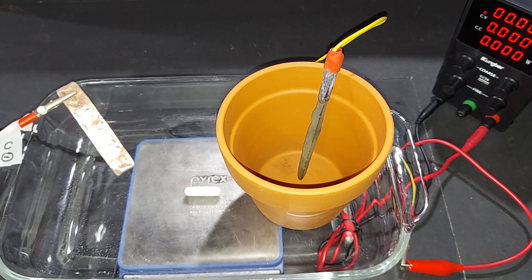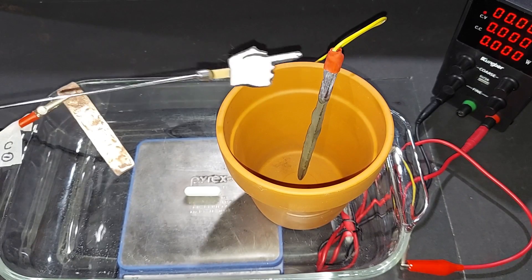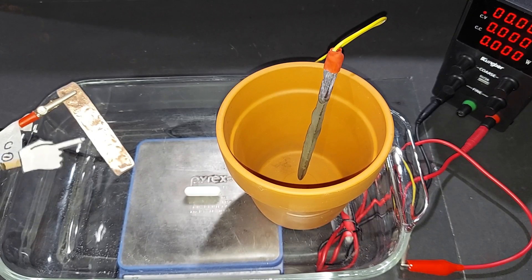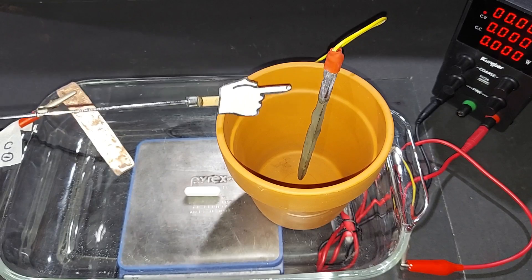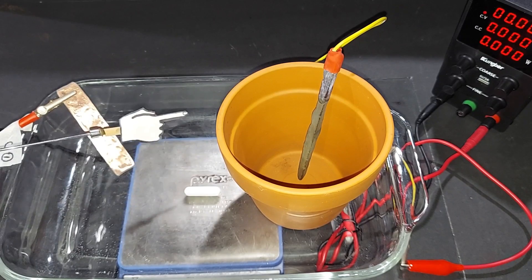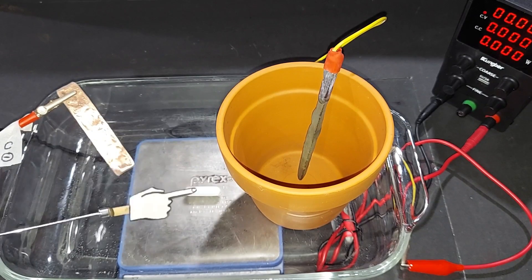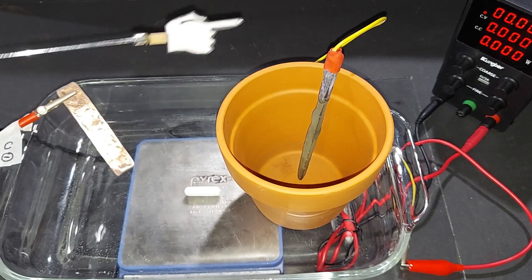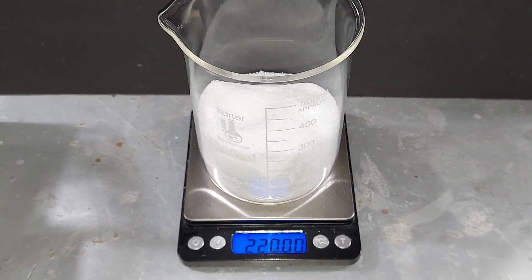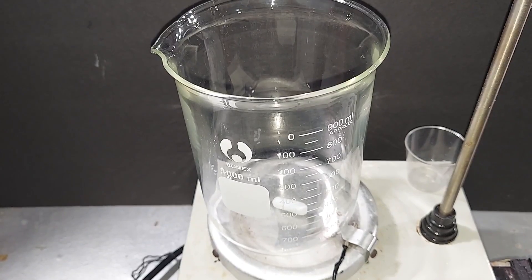Here's the basic setup for our experiment. Here's the power unit, these are the two electrodes—negative is the cathode, positive is the anode. This is copper pipe smashed into a plate for the cathode. On the anode, I made a lead dioxide electrode. This will be filled with the magnesium sulfate solution. I have a magnetic stirrer to keep it moving. Pure distilled water goes in the pot. This will run at around 12 volts with 220 grams of magnesium sulfate.